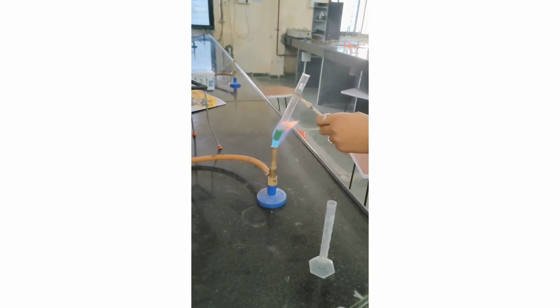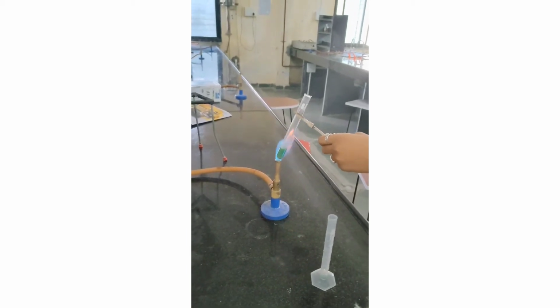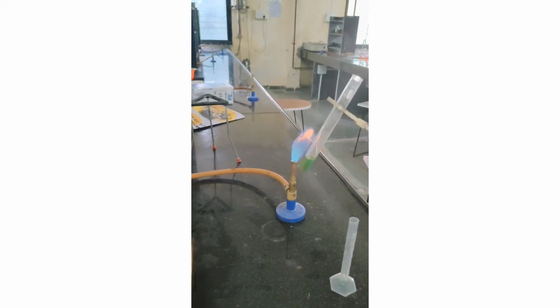If the given sample is a monosaccharide, that is, we have taken the Glucon D sample, that is glucose. So it is the monosaccharide. So the test is positive for the Barfoed test. This is the brick red precipitate observation for the Barfoed test.